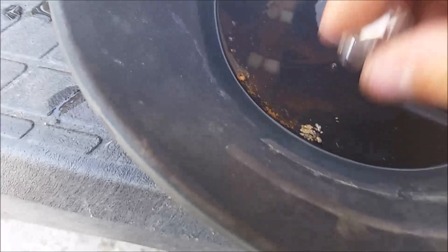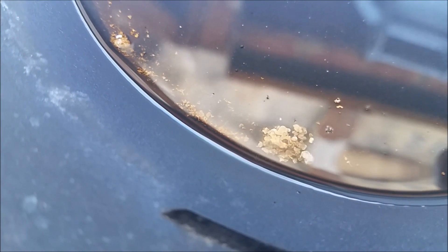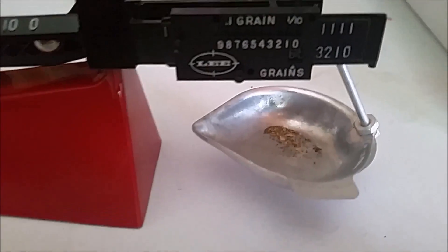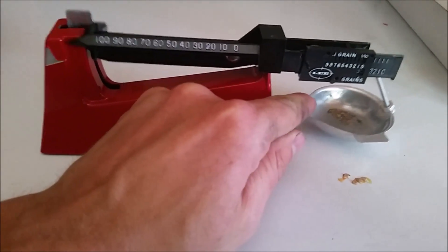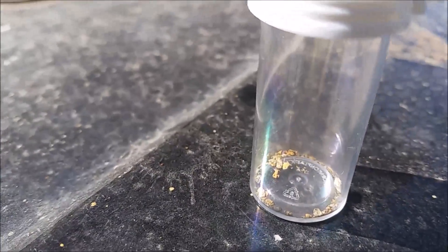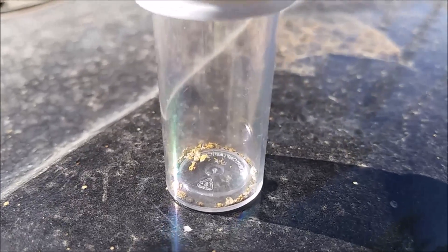Let's go get those other nuggets and put those in there. You'll notice the acid is starting to work on the mercury coating them — should make short work of that. There's the gold. Looks like it's almost exactly six grains, just over a third of a gram. That's a bit less than my estimate, but still pretty cool. I've got a little project planned for this but it'll be a while, so I'm gonna go ahead and shelve this for now.